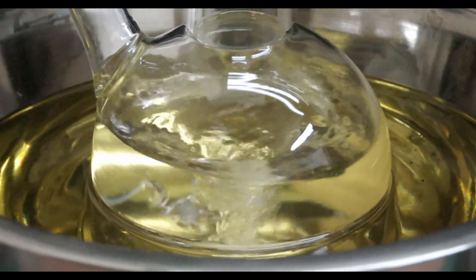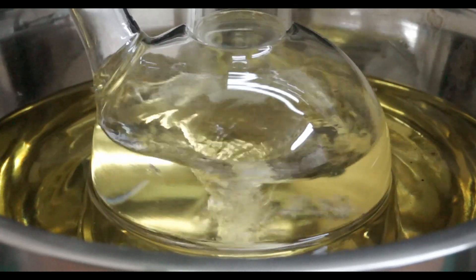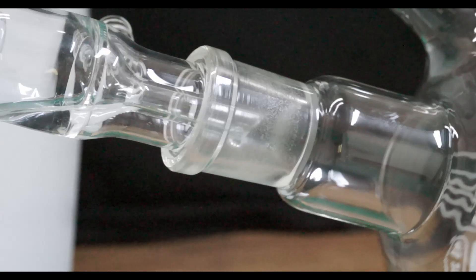I start stirring and heating and soon the content of the flask begins to boil and the distillation of the product proceeds at quite rapid pace. Before the temperature reaches 34 degrees Celsius only approximately 20 to 25 milliliters distilled over.